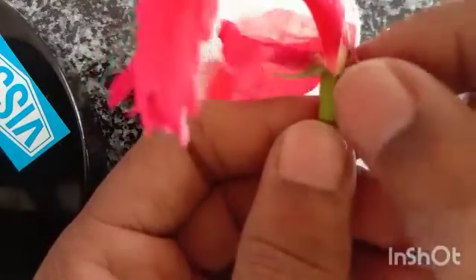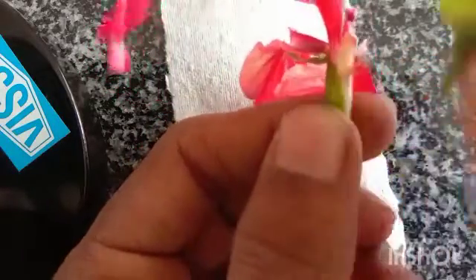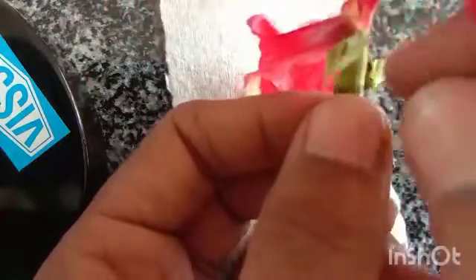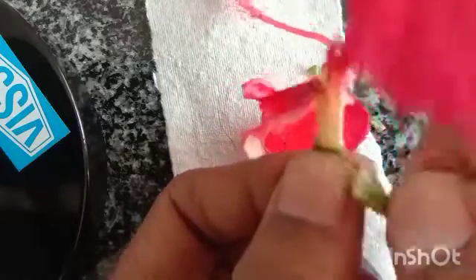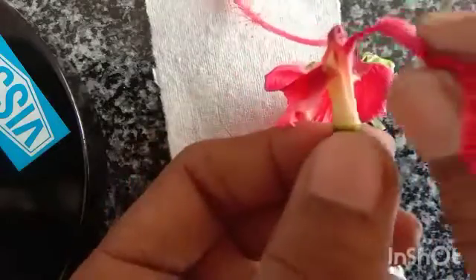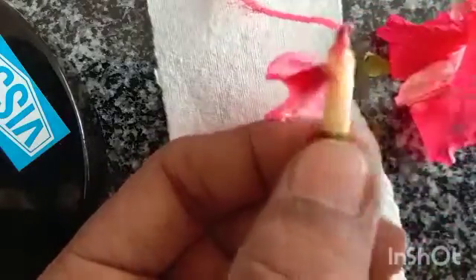Now we are removing the accessory parts of the flower. Calyx and corolla are the accessory parts. Remove the calyx carefully. Like this. And also remove the corolla. Like this you have to remove.